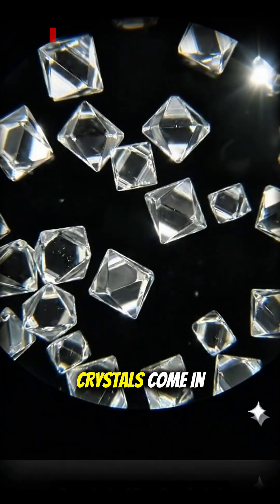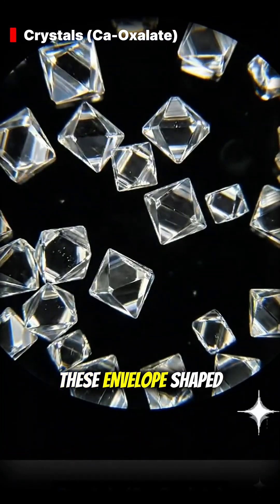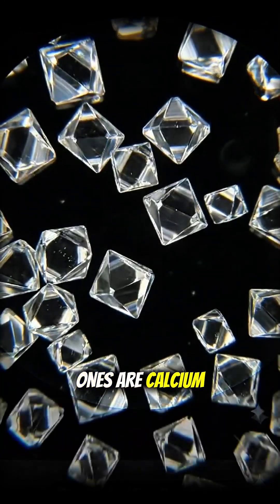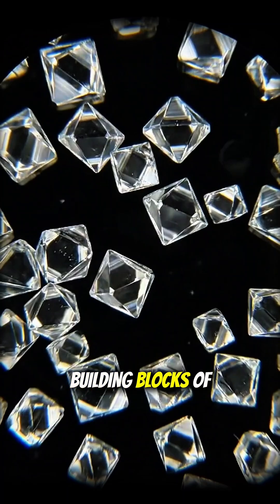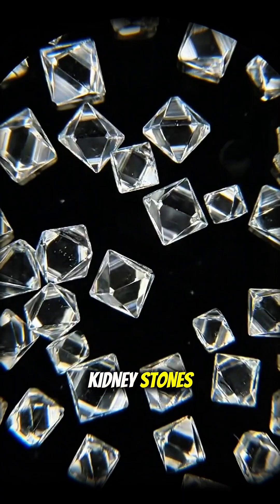Crystals come in many shapes. These envelope-shaped ones are calcium oxalate — they are the building blocks of kidney stones.